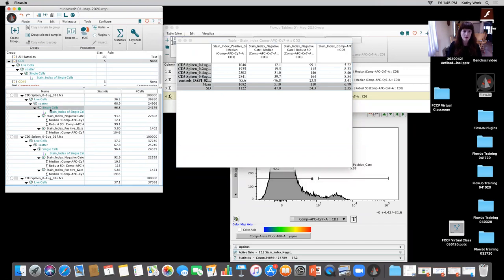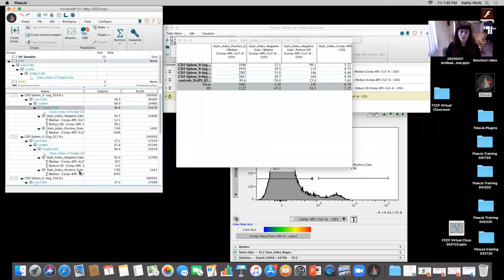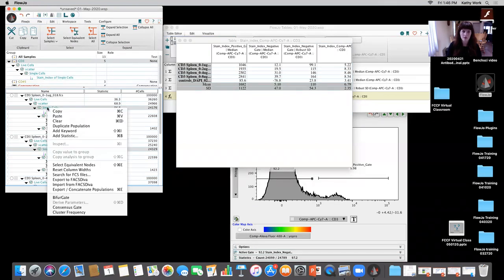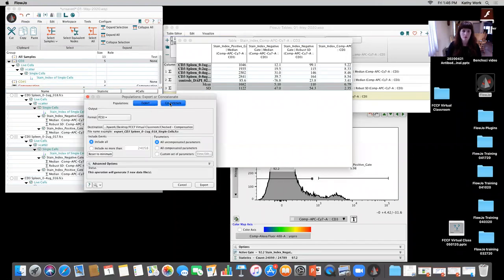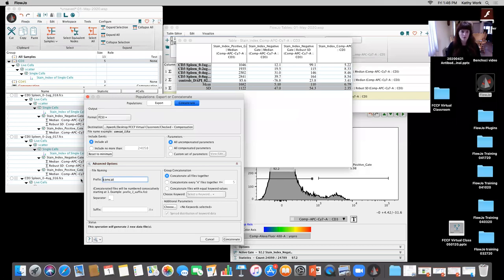So if I go ahead and I go to single cells, I can either right click and choose select equivalent nodes, or I can use the appropriate shortcut keys. Or alternatively, I can come to edit and select equivalent nodes. And then when you do that, you can always right click and you can concatenate those populations together. And I'm gonna show you a very quick view of how we can see that this titration was incorrect in the sense that it did not add in enough antibody and the dilution range was not appropriate to calculate the appropriate titration or the optimal concentration.